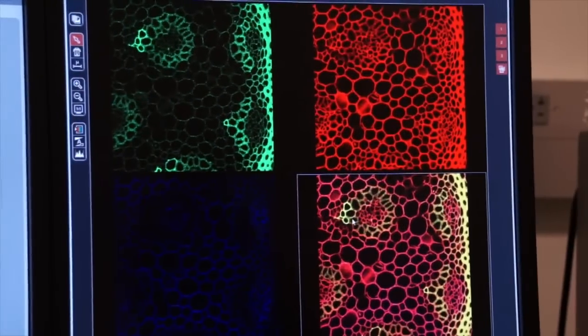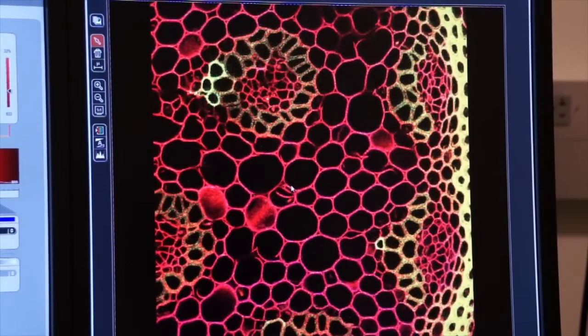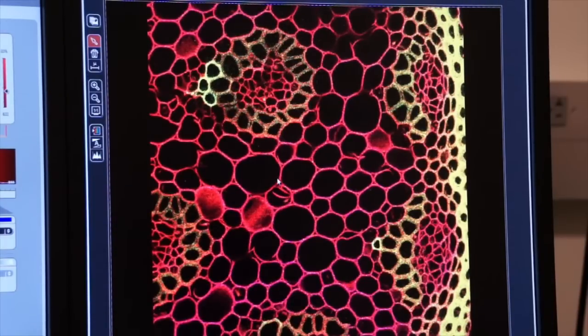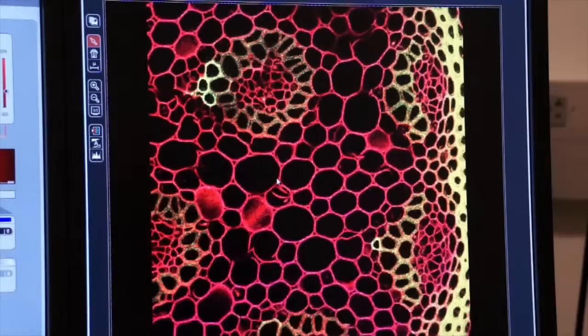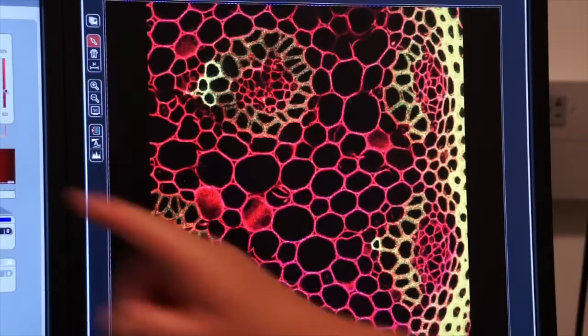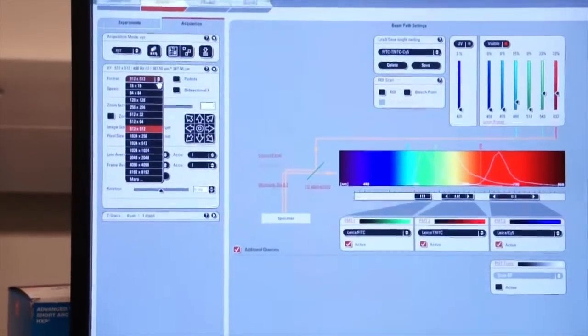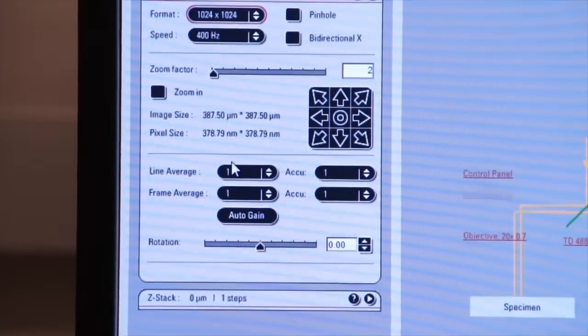And here you see all three of our fluorophores and our composite image. So that's a 512 by 512 image. How do I increase the resolution of this image? There's several ways to do it. I can go back over here to this screen and I can increase my digitizer resolution. So let's go 1024 by 1024.